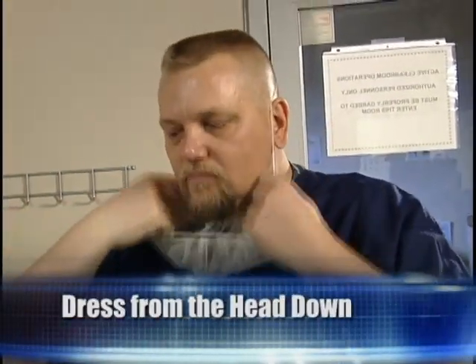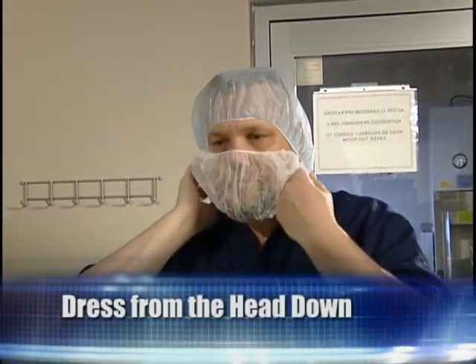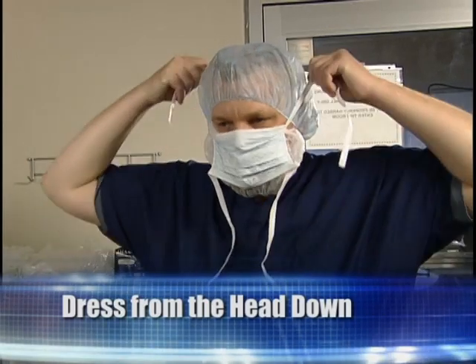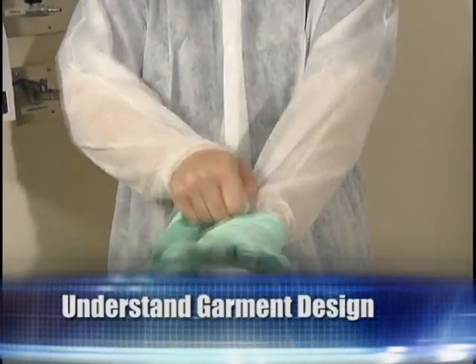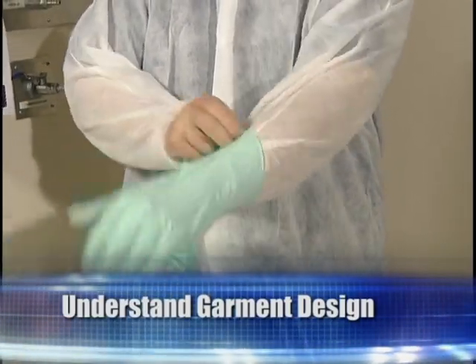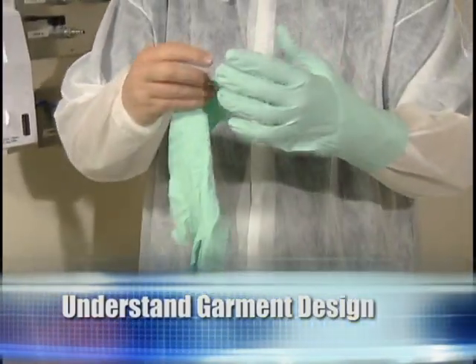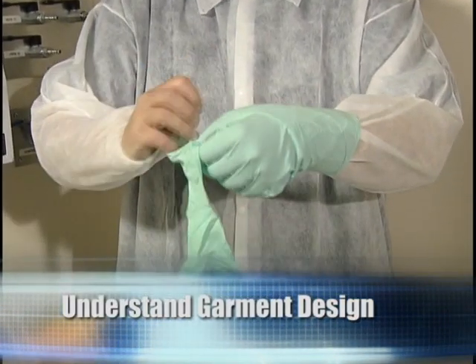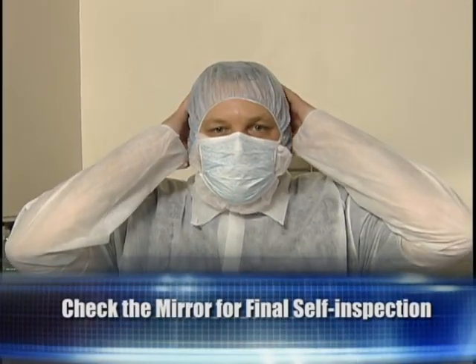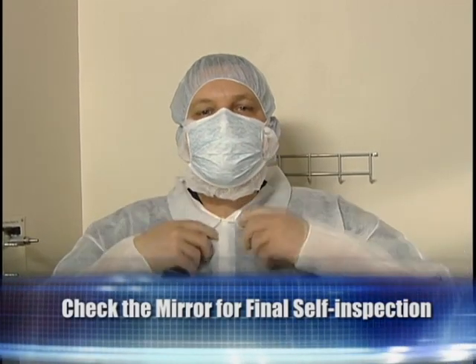Dress from the head down. This ensures that released particles won't fall on clean garments or booties. Understand garment design. In most instances, gloves and booties are worn over coverall sleeves and cuffs, and hoods are tucked inside collars. Know how to properly seal any gaps between clothing. Check the mirror located in the clean area for final self-inspection.